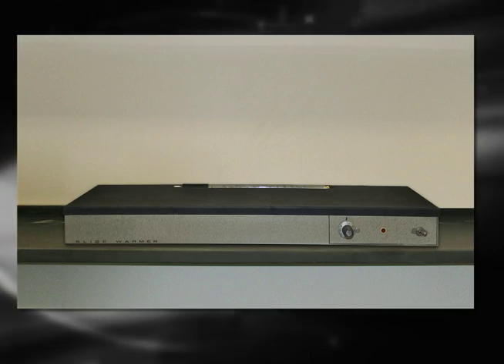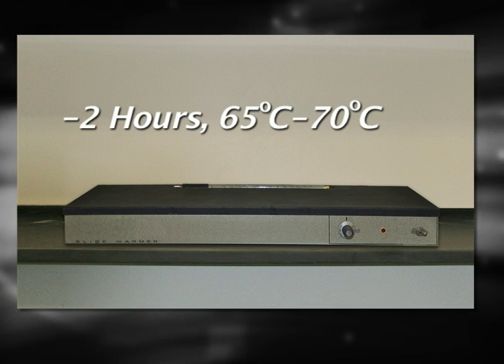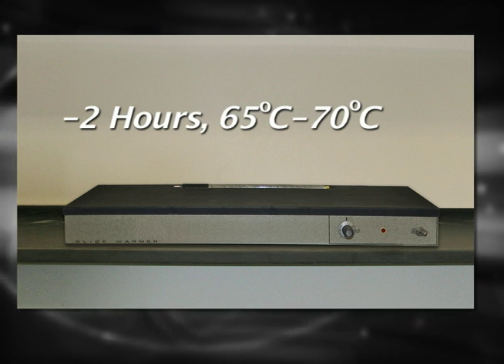Alternatively, when using an electrical heating block, heat fix the slide for two hours at 65 to 70 degrees Celsius.